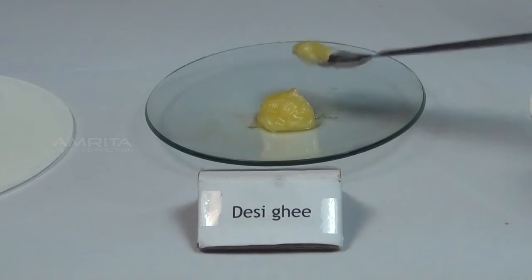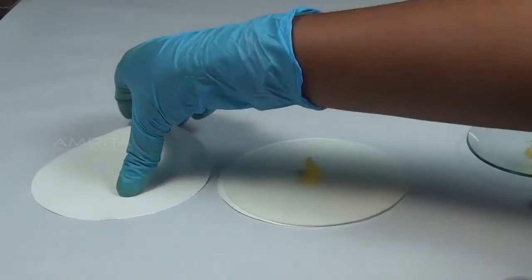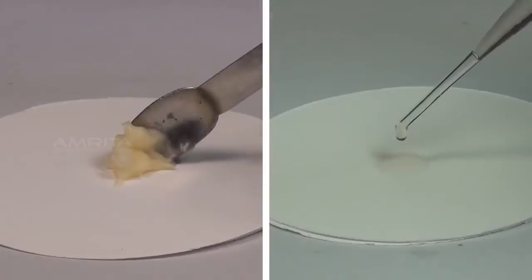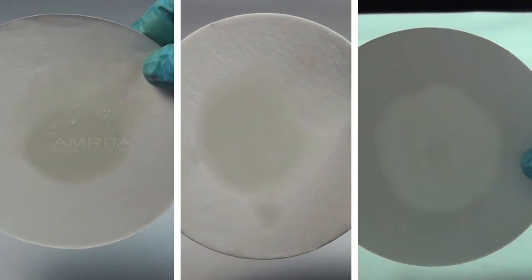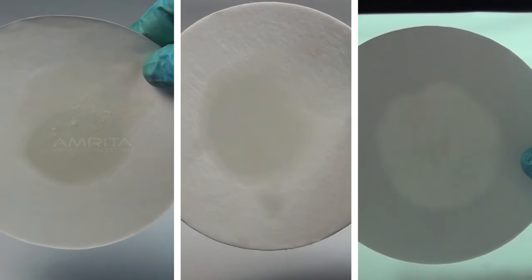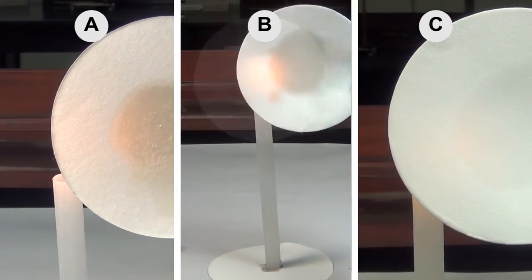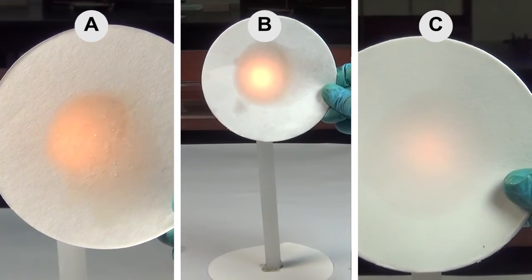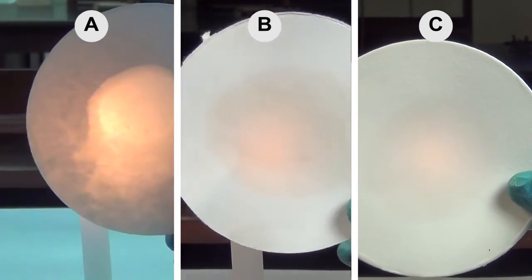Translucent Spot Test. Take a small quantity of desi ghee using a spatula and transfer it onto a filter paper, then press with another filter paper. Repeat with vegetable ghee and refined oil. A translucent spot is formed on the filter papers. Place the filter papers in front of a candle flame — light will be partly visible only through the translucent spot due to diffraction of light.